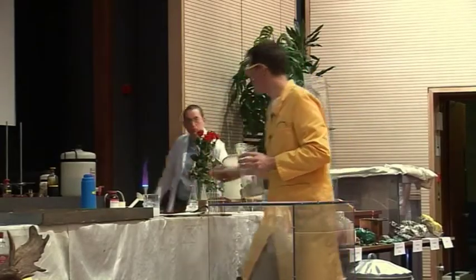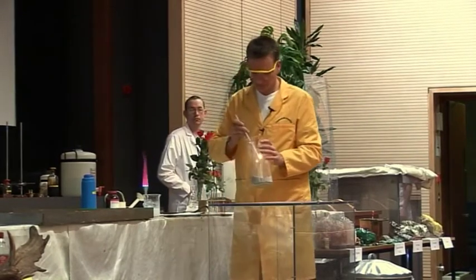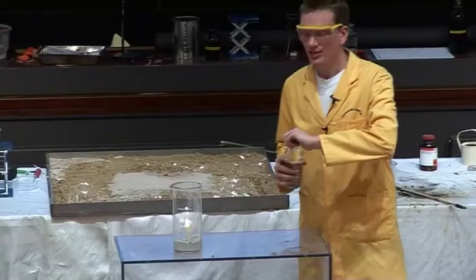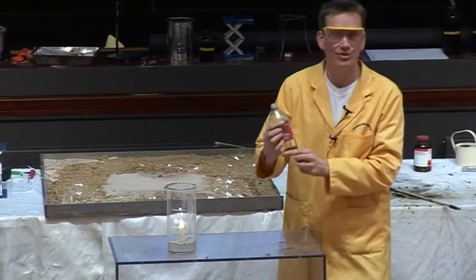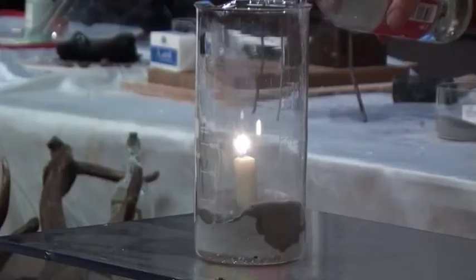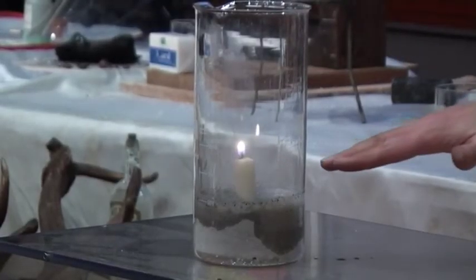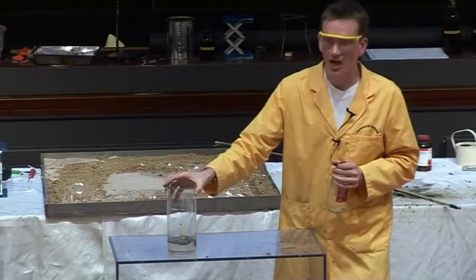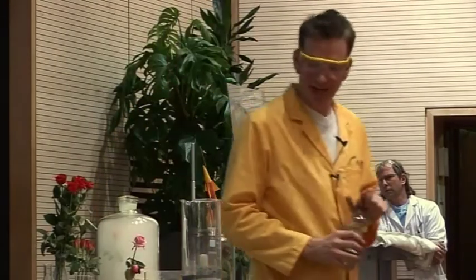I'm going to light my candle. My candle is burning nicely. The ash here contains pot ash, or potassium carbonate. Adding acid — the acid I'm using is just vinegar — adding acid to the carbonate generates carbon dioxide gas, so we can see the bubbles here. The carbon dioxide gas is heavier than air and it's gradually filling up the beaker, and it has now extinguished the candle. That was the carbon dioxide formed from the reaction between the potassium carbonate and the acid.